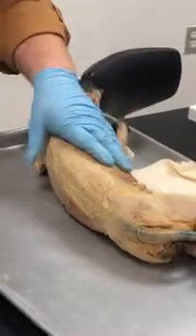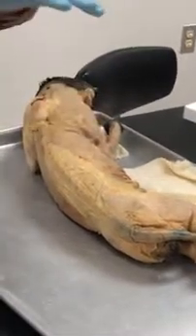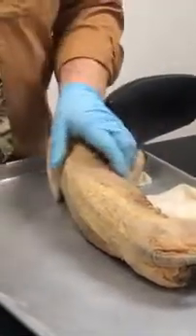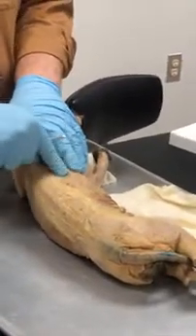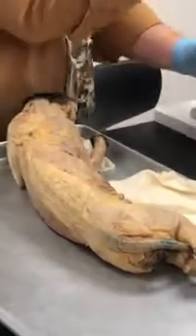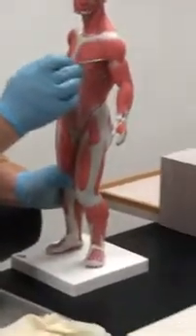There is a deltoid. The problem is on a cat, they have different parts of it: acromiodeltoid, clavodeltoid. They have all these different parts because it's so huge. That to me gets a little bit confusing for students, so I'm not going to hold you responsible for calling the deltoid and trapezius on a cat. On a human, it's different. Here's the trapezius. It looks like a big diamond or a kite. And the deltoid is a shoulder pad over here. Okay? So that's what's going on there.